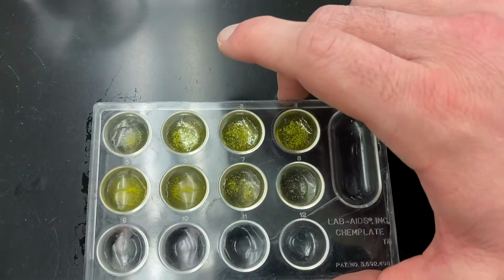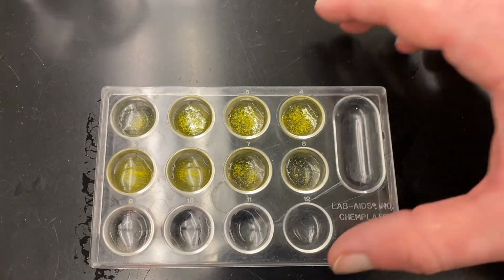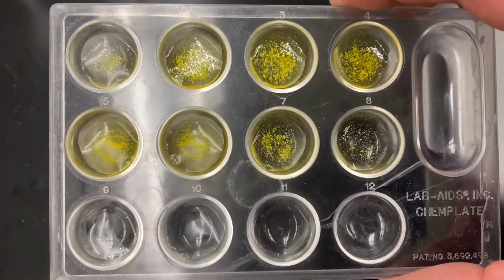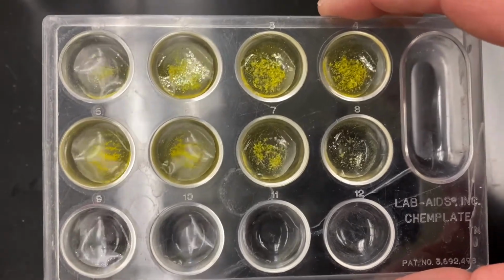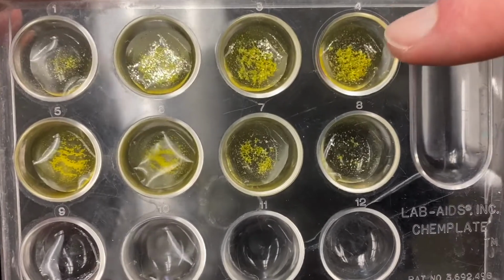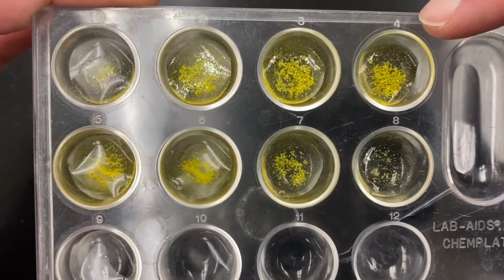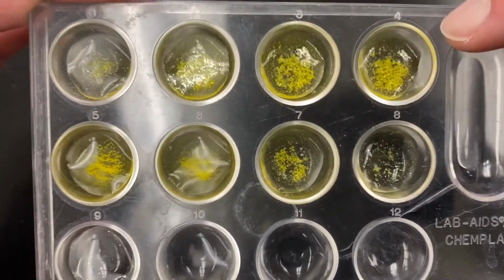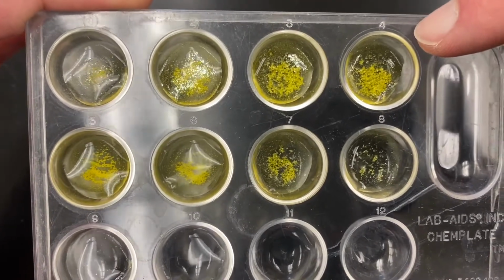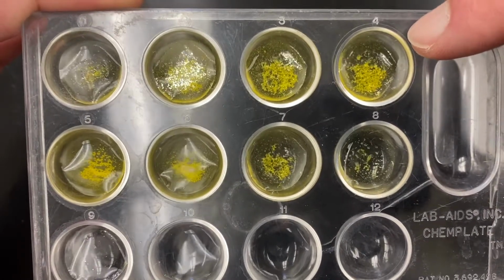and take a look at the results. So if I look closely at my results, I can make a determination as to which cell has the most precipitate. And in terms of the most precipitate produced, it's probably going to be cell 4, which was 4 drops of lead nitrate and 11, 10, 9, 8 drops of the potassium iodide. So 4 drops of lead 2 nitrate and 8 drops of potassium iodide yielded the most precipitate.